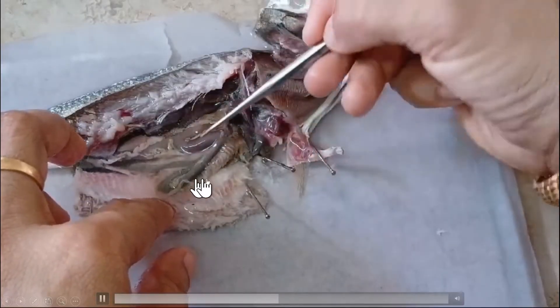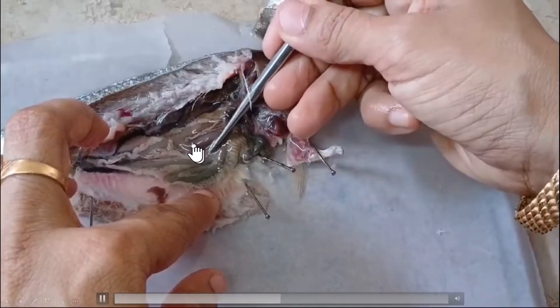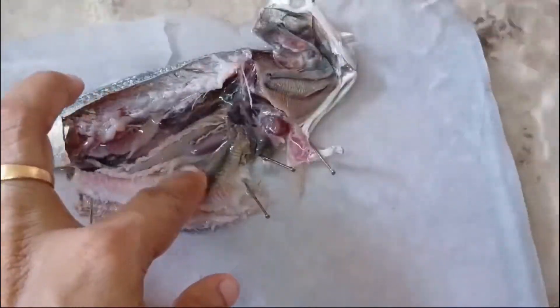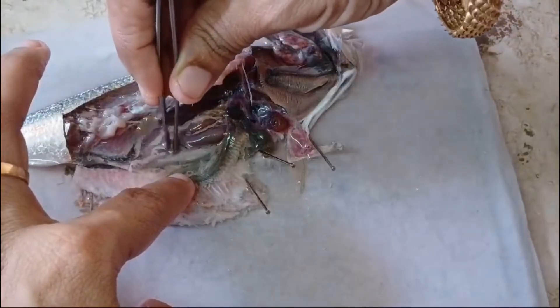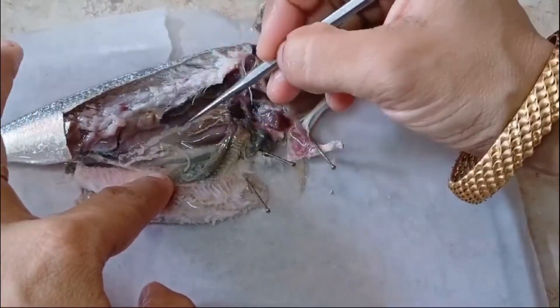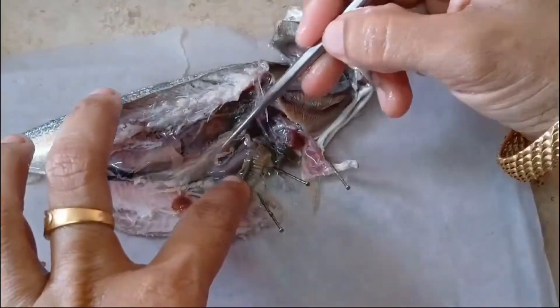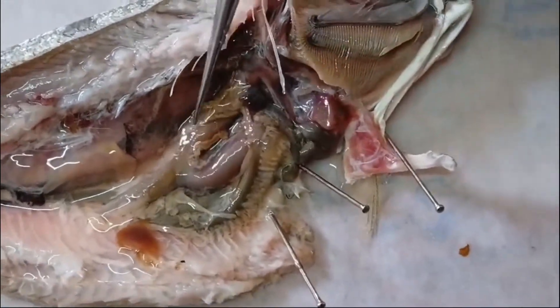Here is one more coil. Look here — you can see that bend, which is a notable feature in the alimentary canal of this fish. You can clearly see the bend portion of the alimentary canal right here.